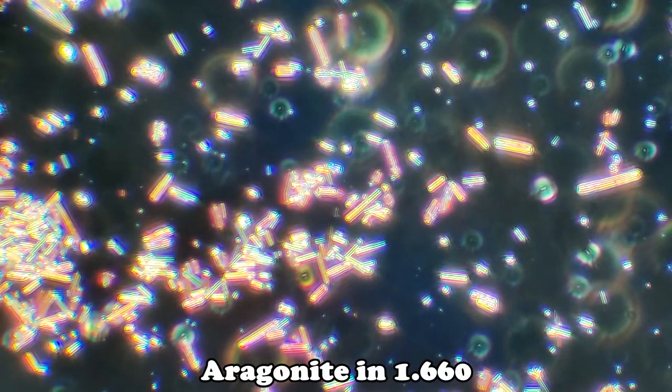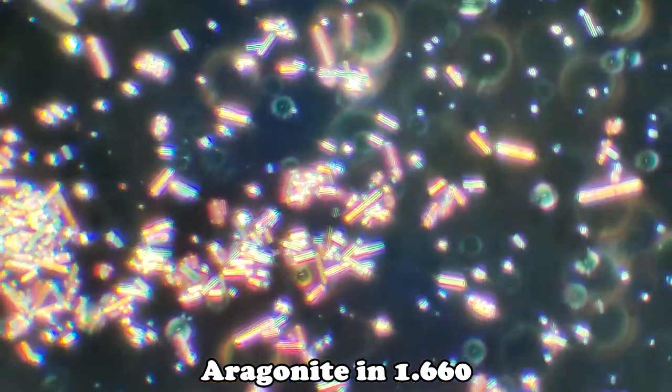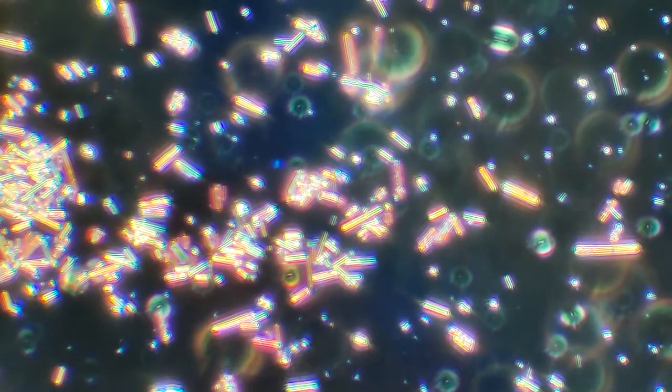During dispersion staining analysis in 1.660, you can see that the dispersion staining colors of aragonite have shifted slightly because of the higher refractive indices compared to calcite.